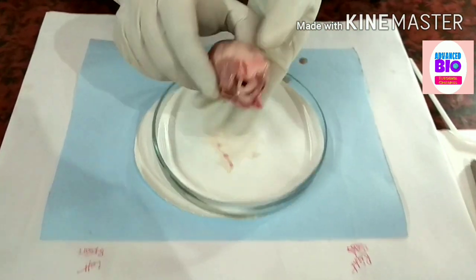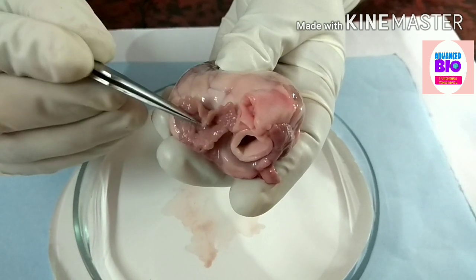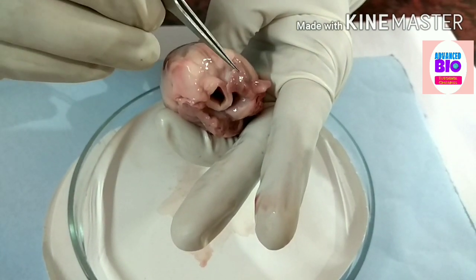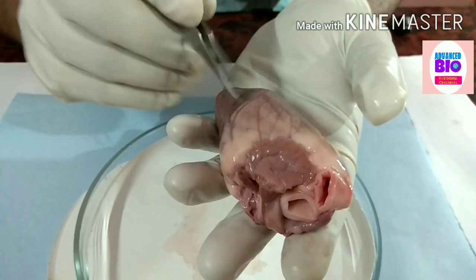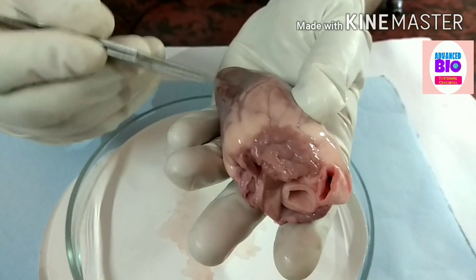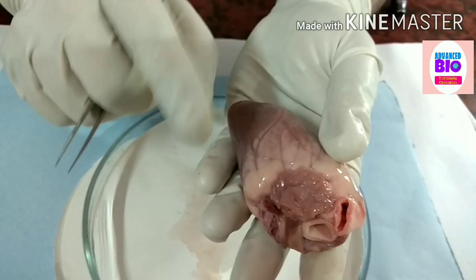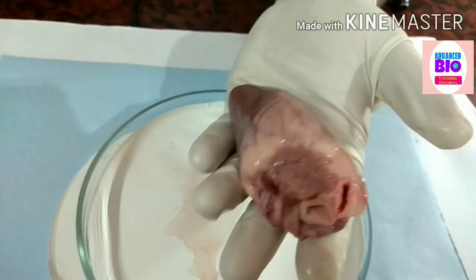Now I am showing you the heart externally. This is the atrium — this is the left atrium and this is the right atrium. Now, what is the ventricle? This is the ventricular part; it is much larger than the atrium. This line is the sulcus — you can trace the interventricular septum by seeing this. So this is the left ventricle and this is the right ventricle.